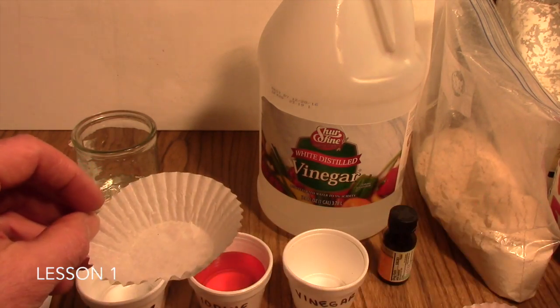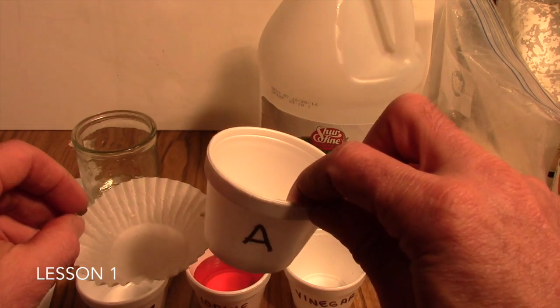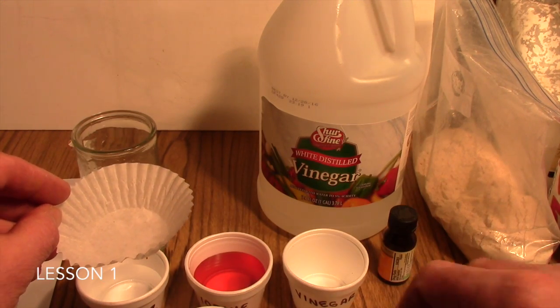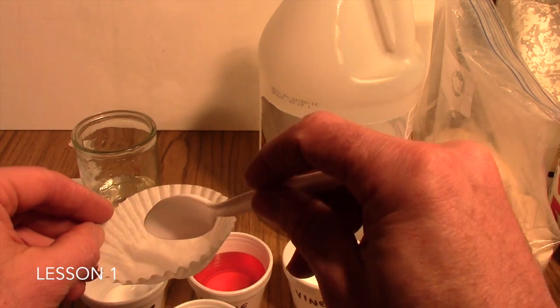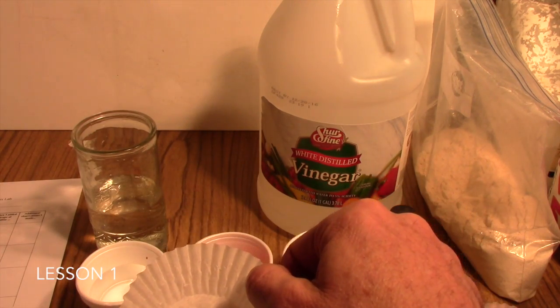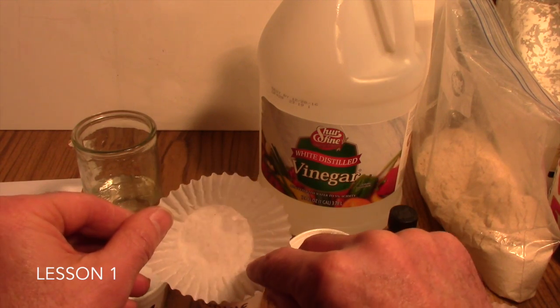So what your student will then do is, let's say for example this cup A, you've put white sugar into it, but your students won't know that. So you'll pass these around for your students to get a sample, and so they'll put a sample of the sugar into their testing tray here. We'll just call it the cupcake liner there.